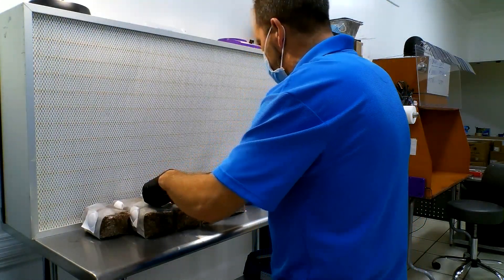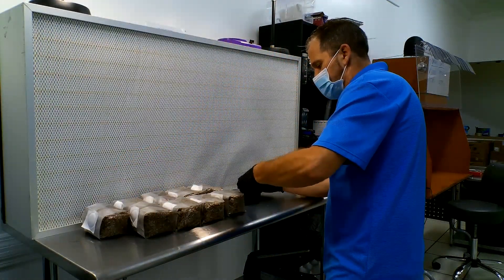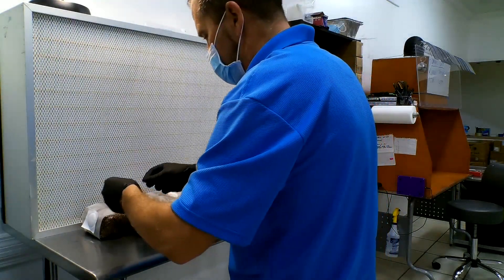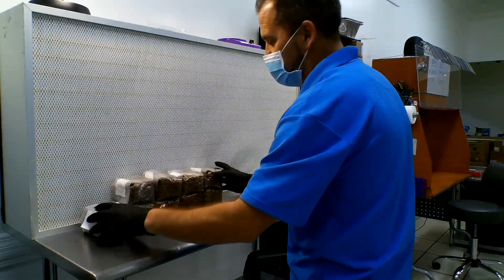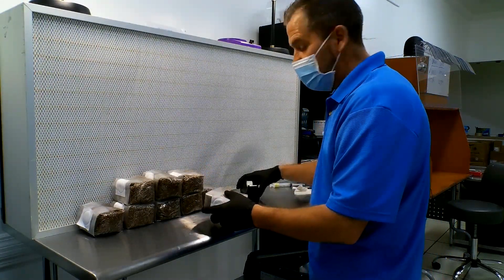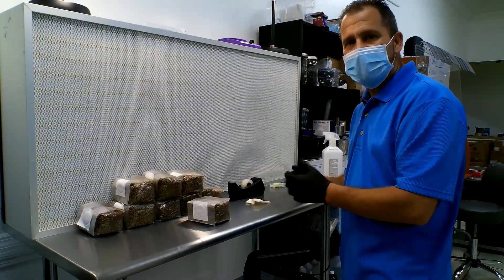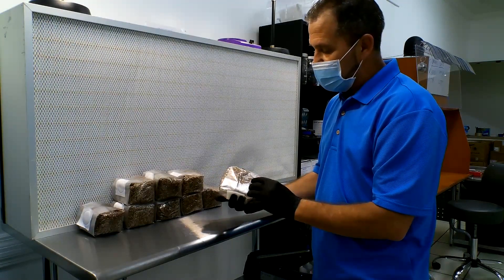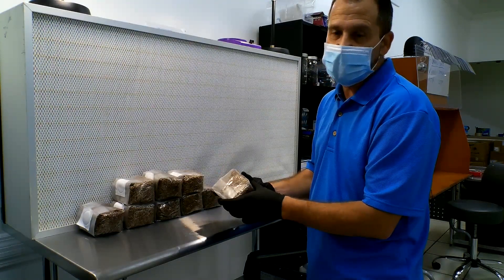This is not hard, and this is about 99% effective. We have very few contaminated rye berry blocks here. As long as you're really adamant about the cleaning and working in front of the hood, this is a 100% effective way of doing this.